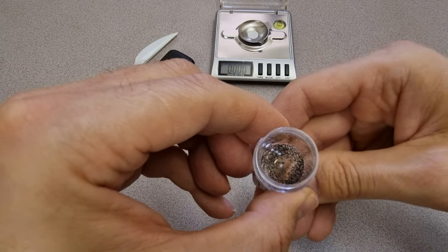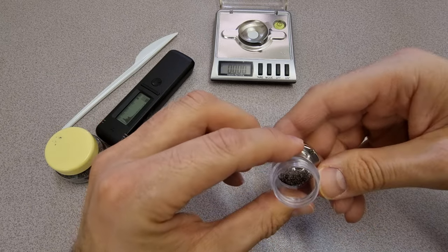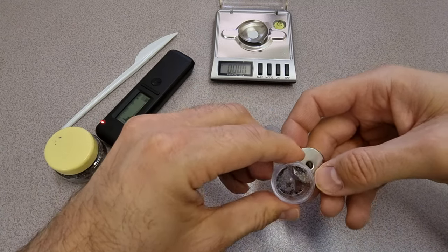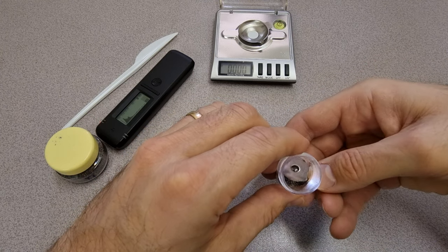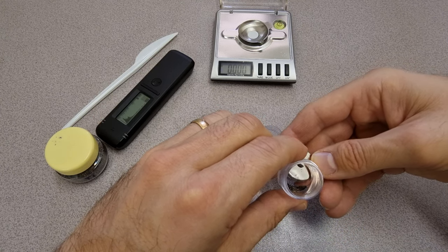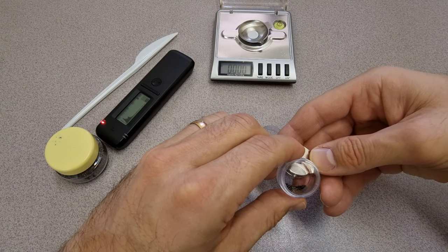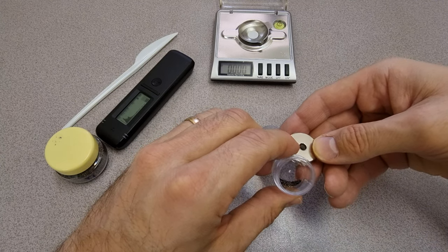So this may not work. Maybe you can go over there and... No, it just doesn't seem to be strong enough to move these particles. I'm getting a few, but this isn't going to be the way to do this. We might just have to sample the whole lot anyway.